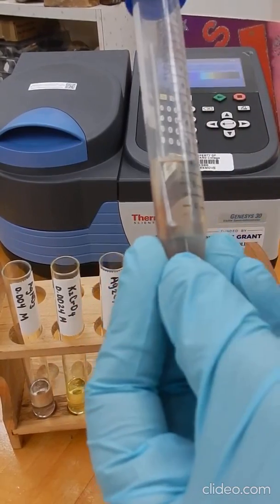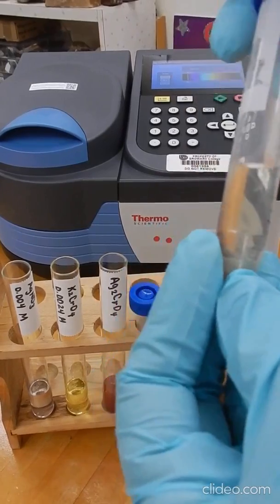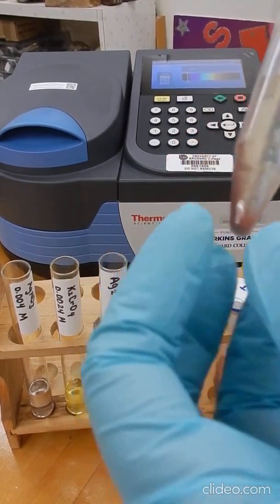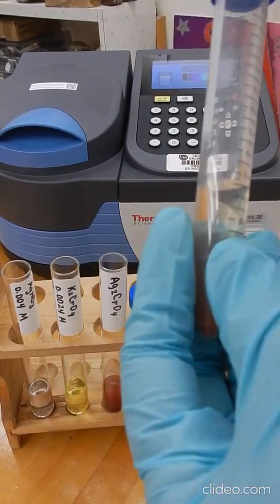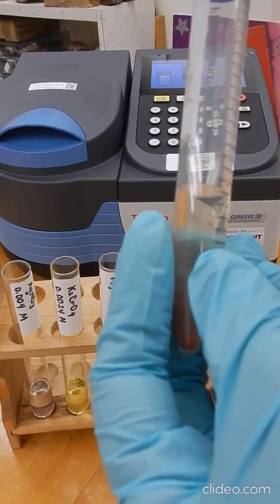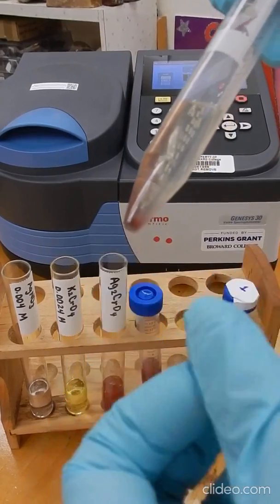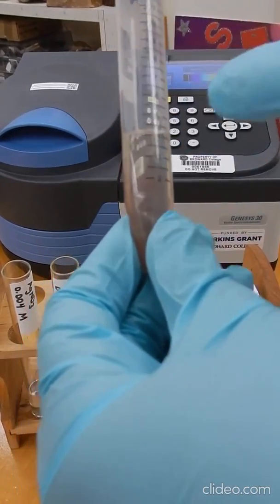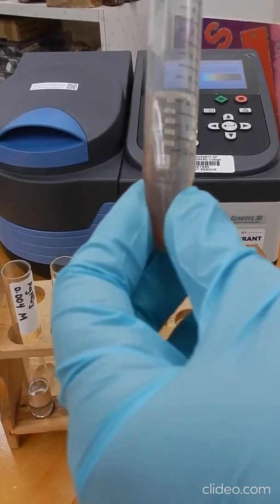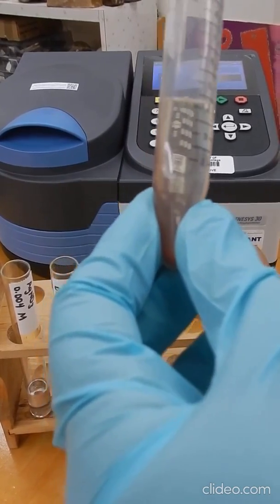What we're trying to accomplish with this step is to remove any chromate ions that are remaining in that solution, because when we're measuring absorbance for this sample, we want the absorbance from the chromate ion that is coming from the dissolution of the solid that you have here. If there are some chromate ions in your solution that are just from your potassium chromate solution, we want to make sure that those ions are not present, affecting our measurement.